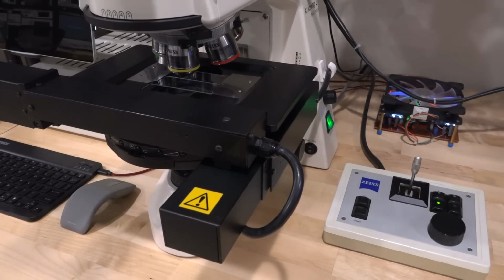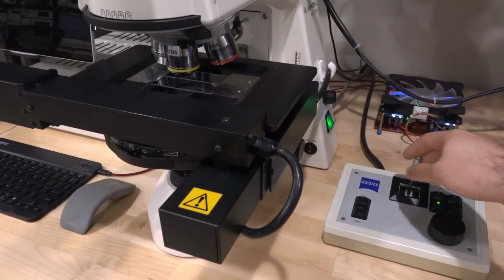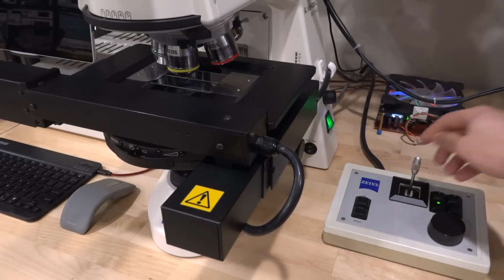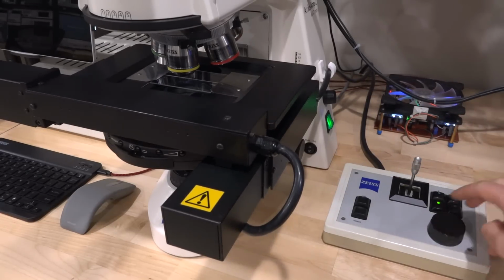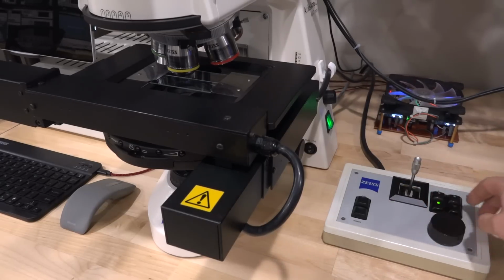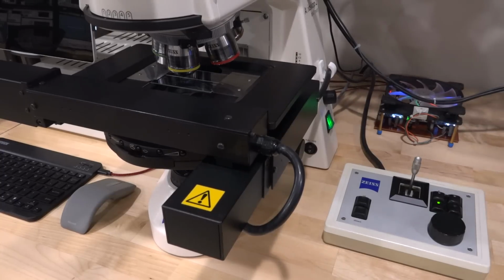The controller is also connected with the CAN bus to the back of the microscope itself, allowing you to control the entire thing with a single serial port and the appropriate software you can write, of course, on the computer. Now, this is really convenient because now we can move the stage of the microscope with this joystick. And it does have an optical encoder here, which allows you to move it really, really fine. You can't even see it moving now, but of course, the image is moving micrometers at a time. And you can do that both in the X and the Y axis.